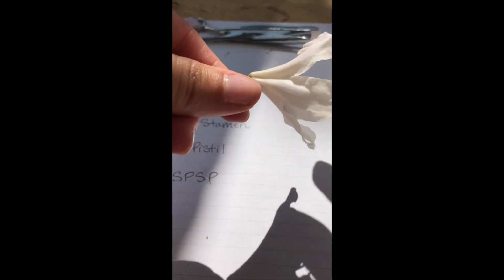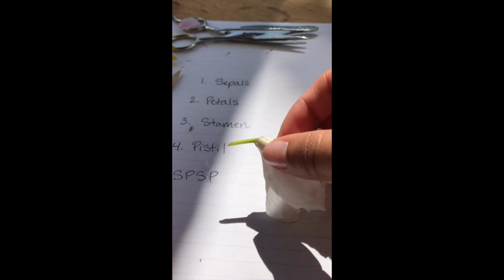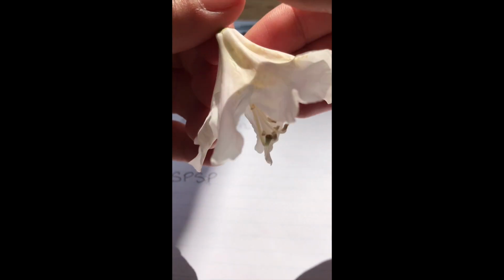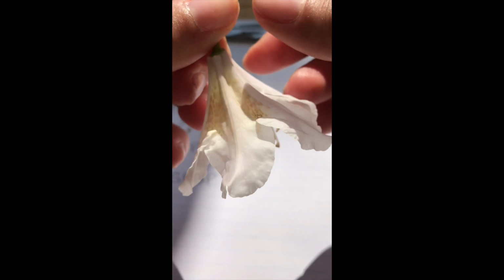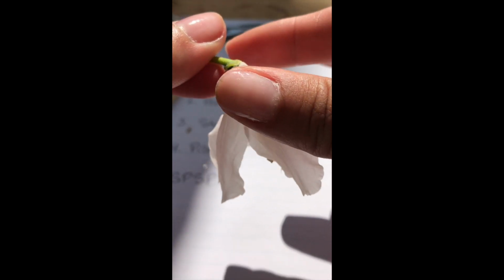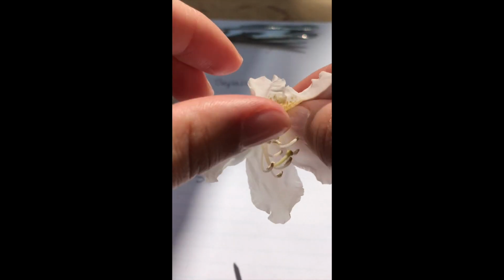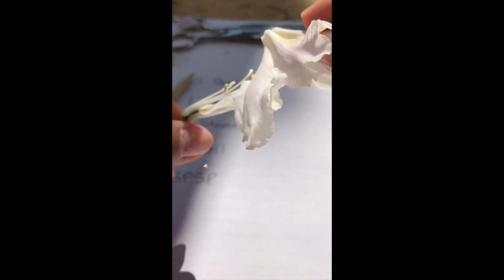So this might be a flower where if you're dissecting something like this, there's not really a sepal to pull off. So you might want to just sketch it before you pull your flower apart, or if you pull it gently at the base, you'll see that the petals will detach just a little bit. You want to be very careful to not rip all of the parts of the flower off at once. But if you see, I kind of got it started. There's space in between the sepal and the petals now. So now I can go ahead and gently remove the petals.